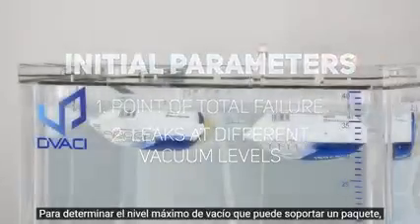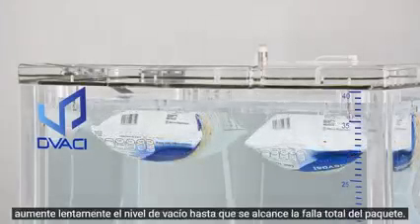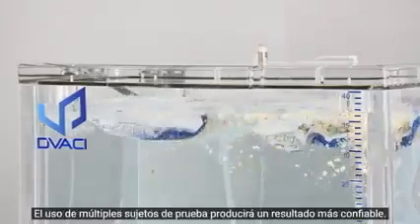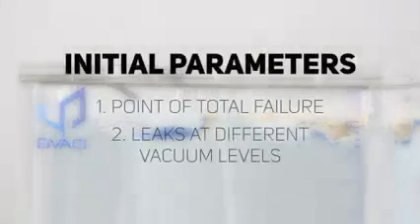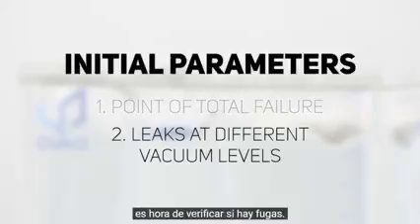To determine the maximum level of vacuum that a package can withstand, slowly increase the vacuum level until complete failure of the package is reached. Using multiple test samples will yield a more reliable result. Once the point of complete failure has been determined and confirmed by multiple tests, it's time to check for leaks.